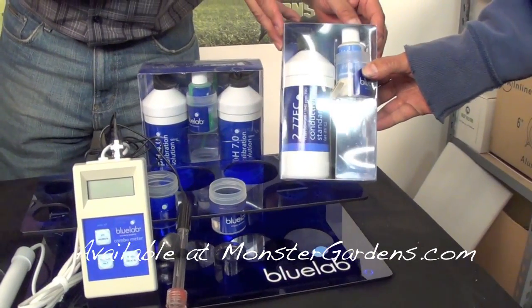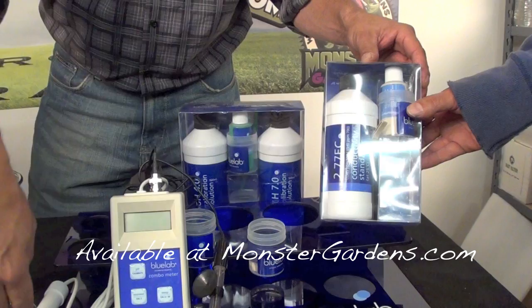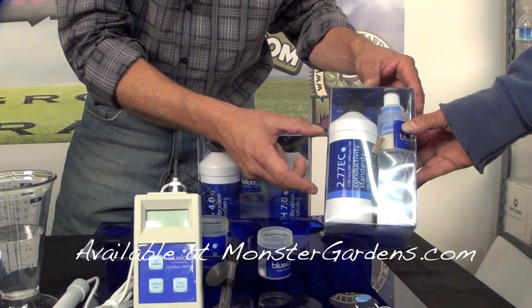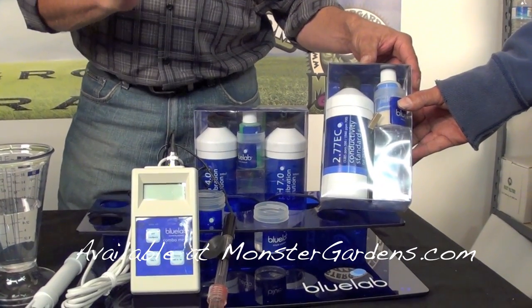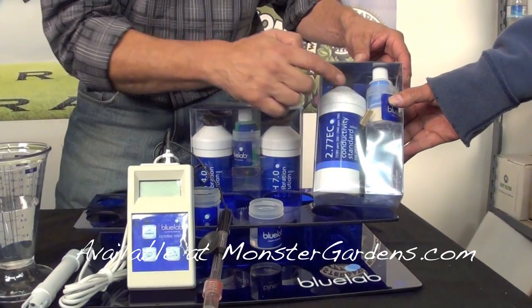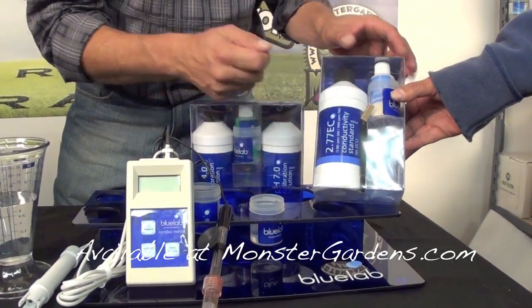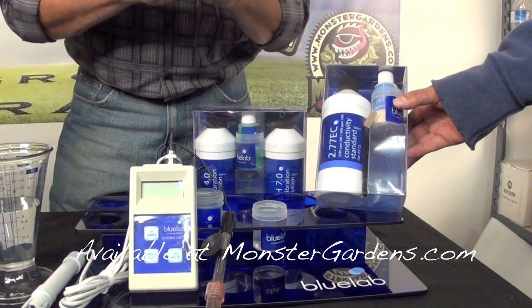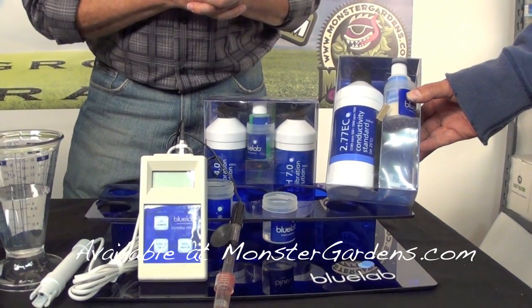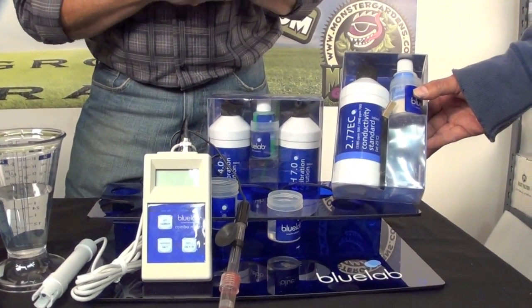This is your conductivity probe cleaner. When you're using your probe — whether it's the truncheon or one of the probes from the combo meters — you want to take a reading to make sure you're getting a proper reading. It's going to read a little low if it's dirty. Big thing about probes: you've got to keep them clean to make them last. There's a cleaning solution in here — it's a soft abrasive with a little chamois cleaner. Wipe it really well and then rinse thoroughly. It's calibrated at the manufacturer in New Zealand, but this is a great way to ensure proper readings with your PPM and EC probes.